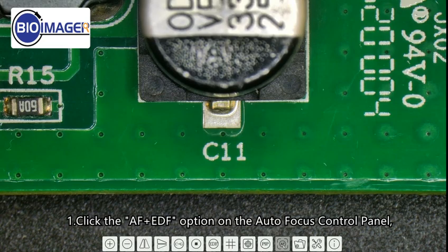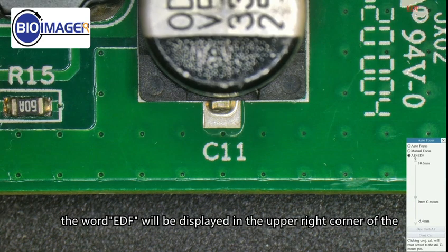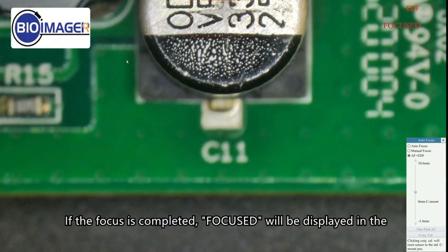Click the AF plus EDF option on the autofocus control panel. The word EDF will be displayed in the upper right corner of the video interface. Click the first focus region. The system will perform autofocus for once. If the focus is completed, focused will be displayed in the upper right corner.